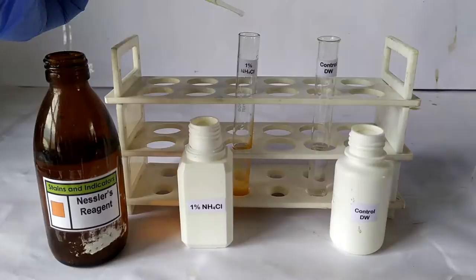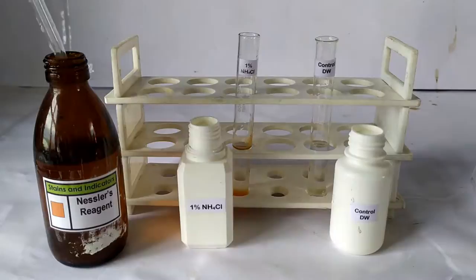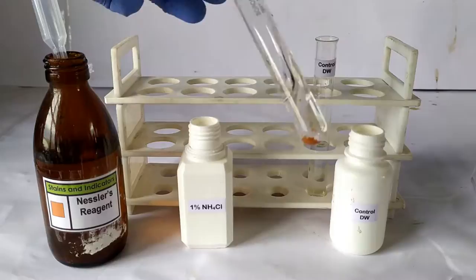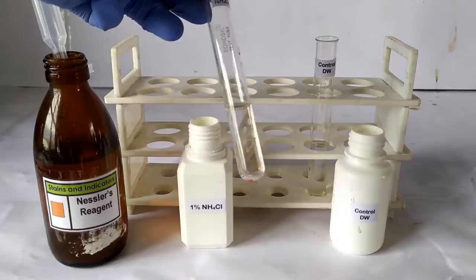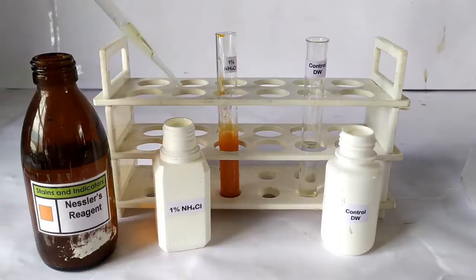Now add several drops of Nessler's reagent to both the tubes. Observe the tubes for any color change. The solution in the tube, if it contains ammonia or ammonium, will immediately show a yellowish-orange to dirty brown precipitate. This may dissolve at first; however, on adding several more drops of the reagent, the precipitate intensifies in quantity and color.